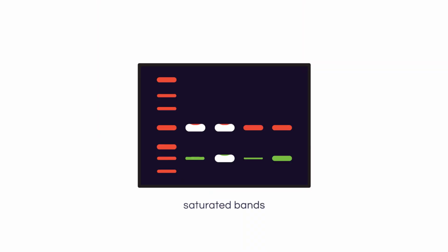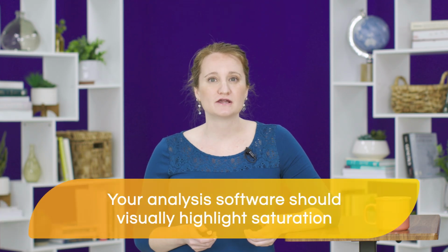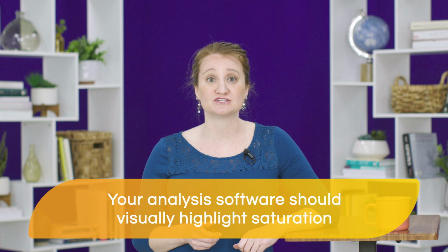Because the instrument was unable to accurately collect data from the membrane, the software should report the signal for that band as not a number, or NaN, or infinity. The software should not provide a numerical signal value. Your analysis software should also visually highlight saturation on your images. It'll typically be done by displaying saturated pixels in a different color. This may be an option for your software, and you should always make sure that it's enabled in your analysis.